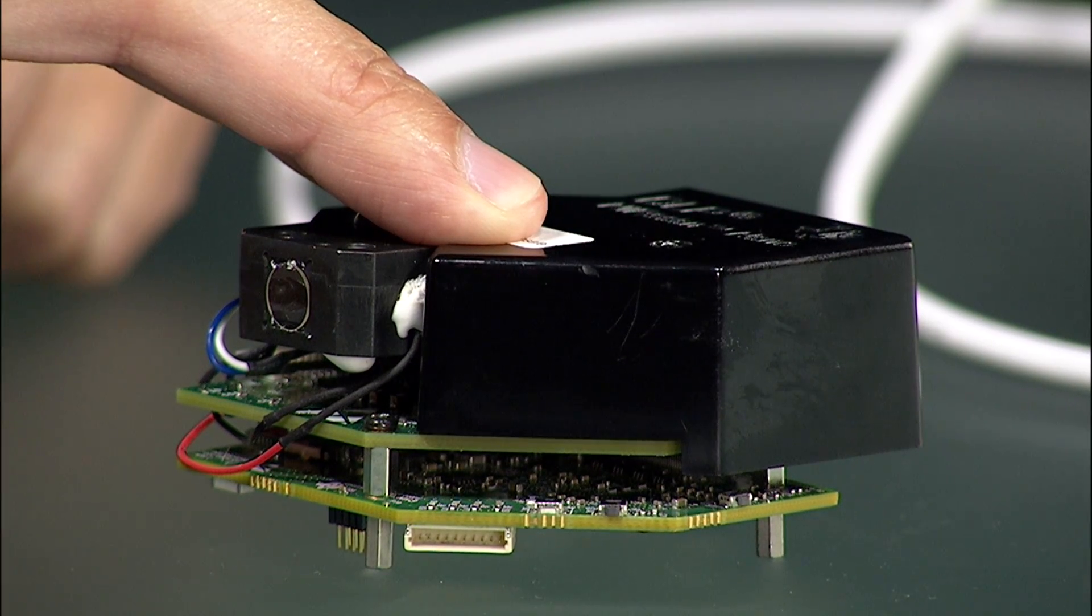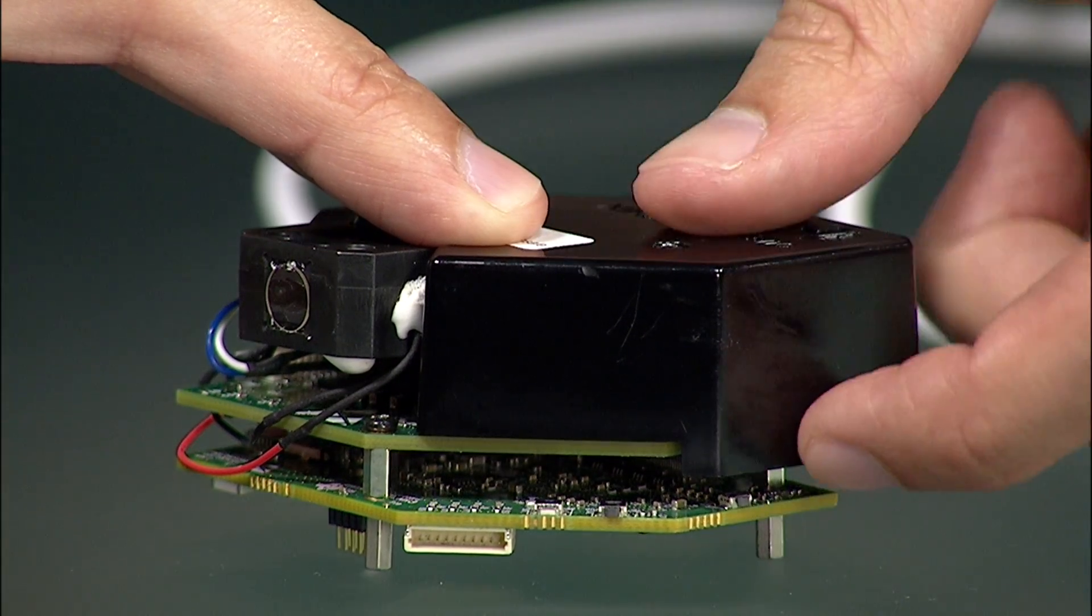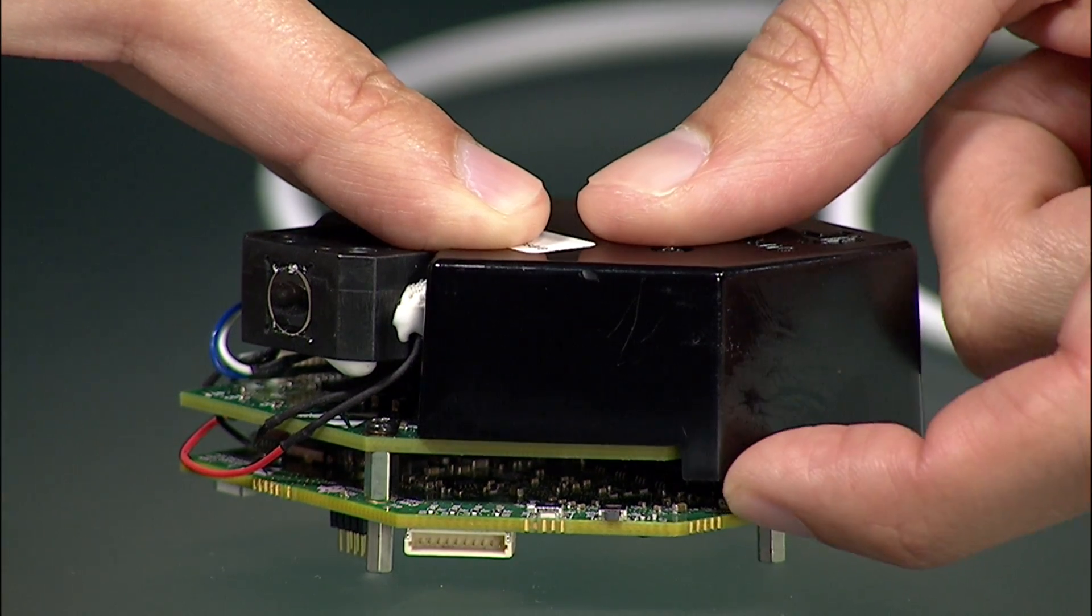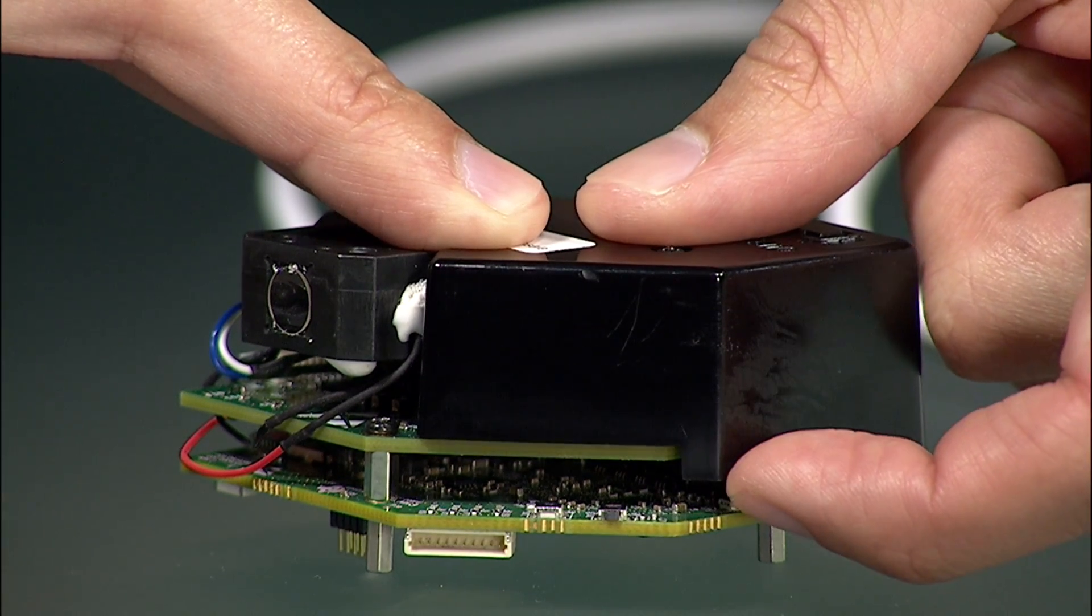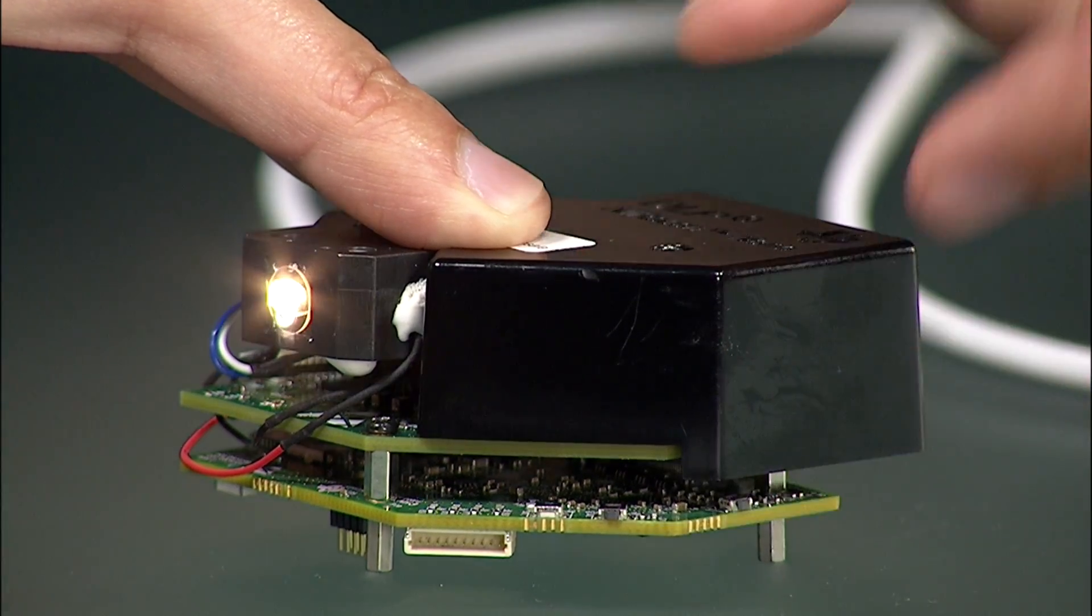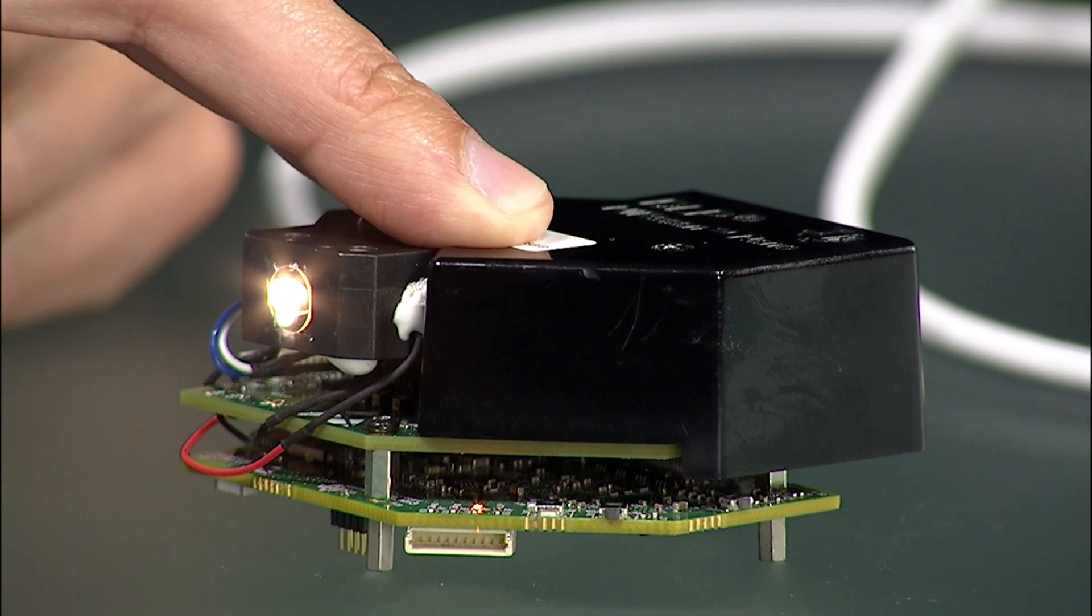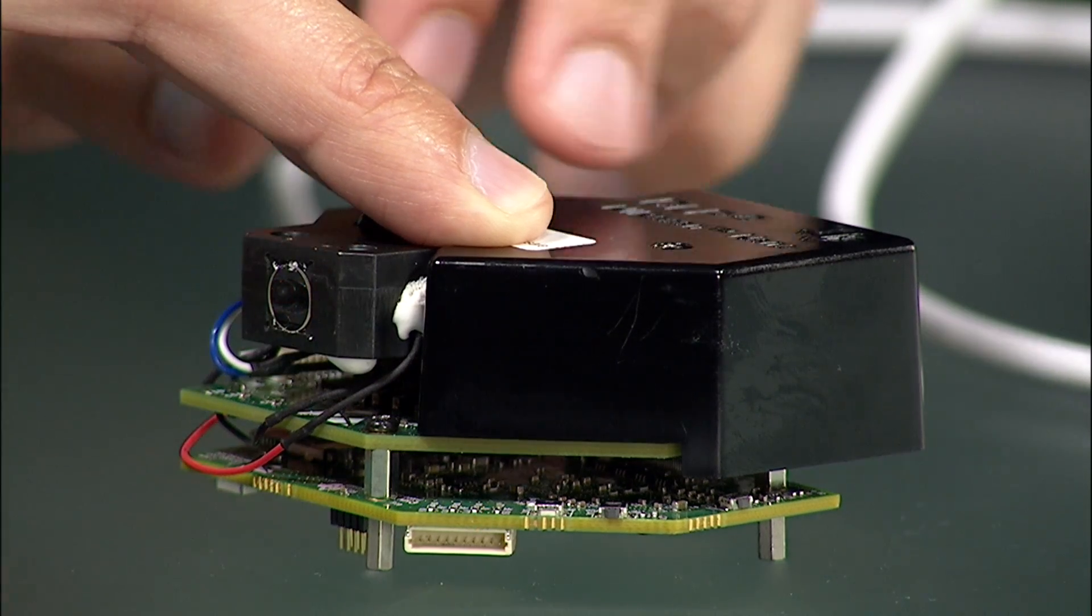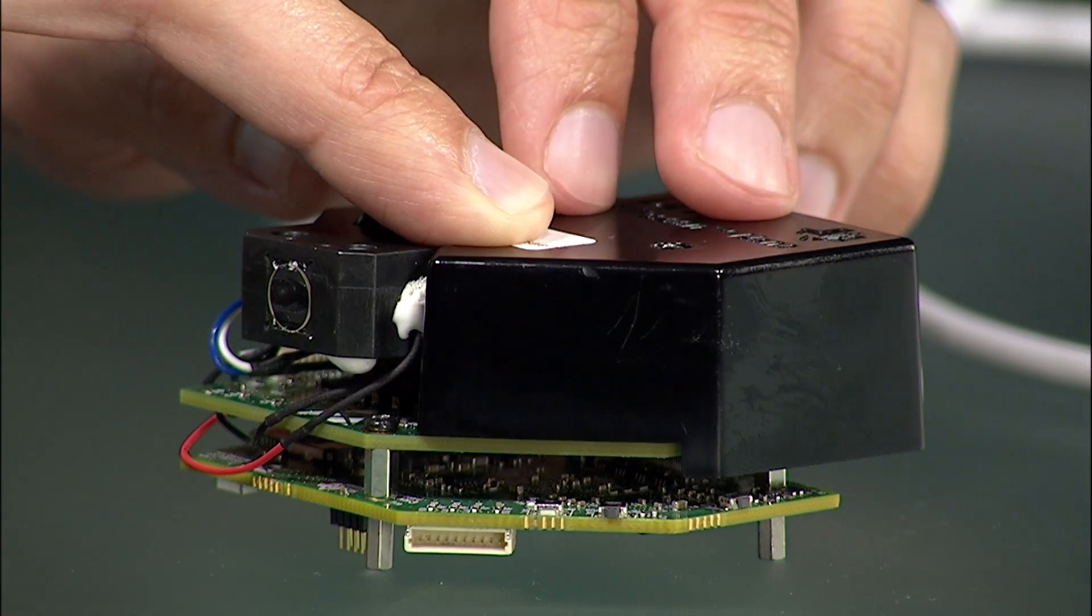The Scan Bluetooth button performs a scan when pressed. During a scan, the yellow LED is illuminated and the lamps will turn on for the duration of the scan.